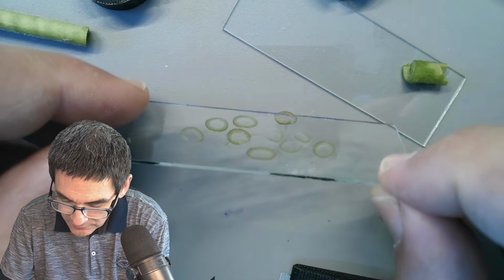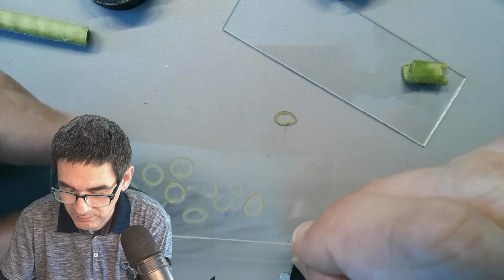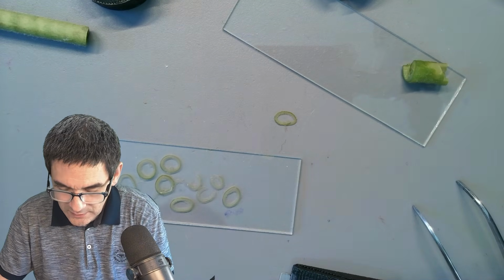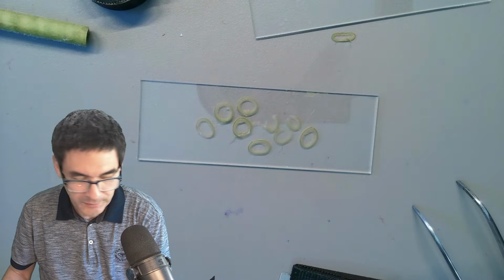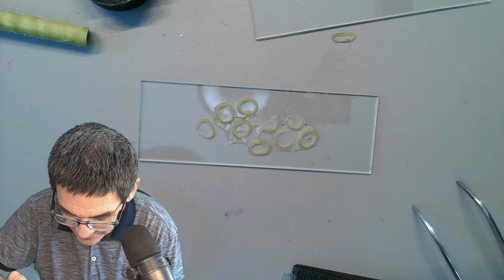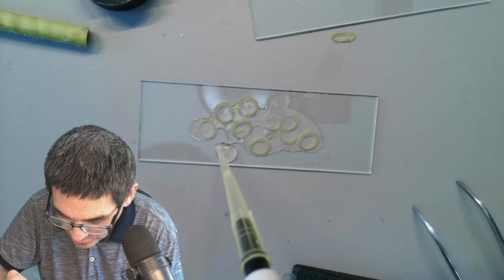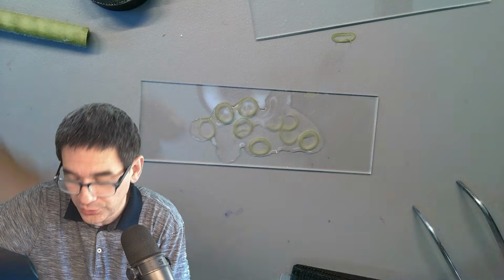Or maybe I can just see it from the side a little bit. It's difficult to see which one is actually thicker. Let's see. Over here I have a fairly large cover glass, a huge one, and I'm going to now add a little bit of simply tap water, and then let's put this on top. So I'm just going to drop it directly on the cross sections here. Might be a little too much water. That's perfectly fine. I'll simply use some tissue paper to absorb the rest. And a large cover glass goes on top.